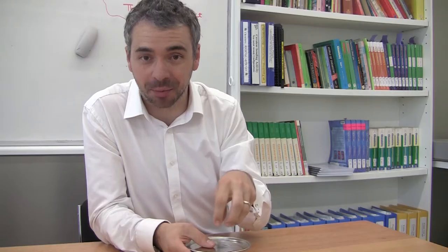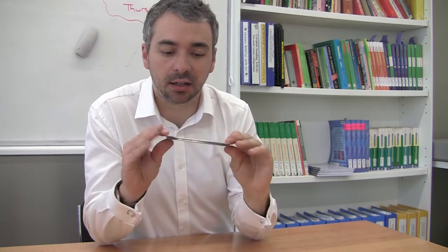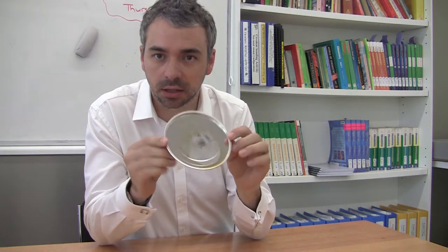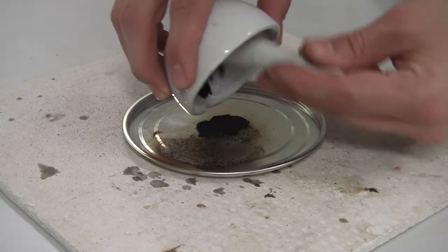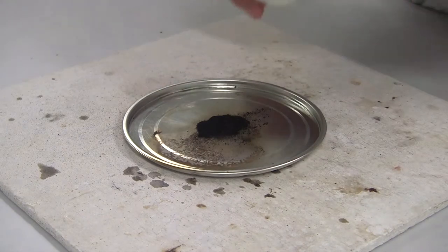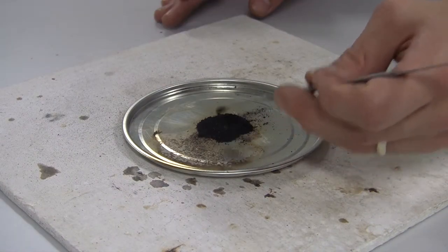Don't smash it but just grind it up a bit and get a little coffee tin lid or something simple like this and just put a little pile in there. Make a little bit of a well in the middle for the glycerol to eventually get dropped in.